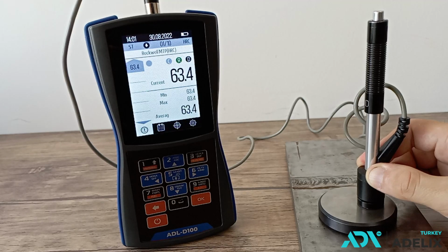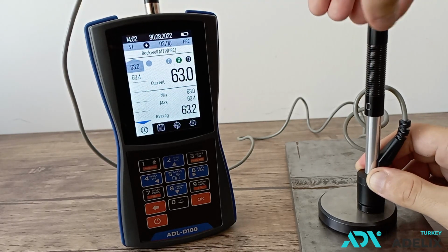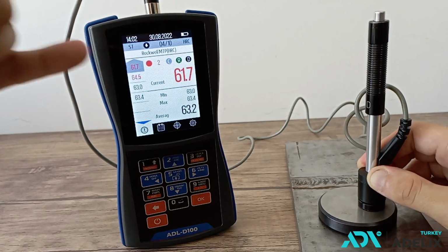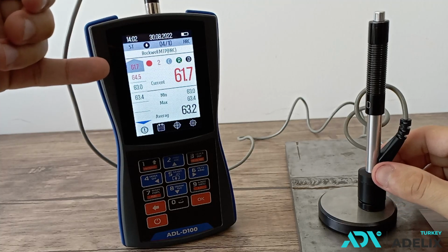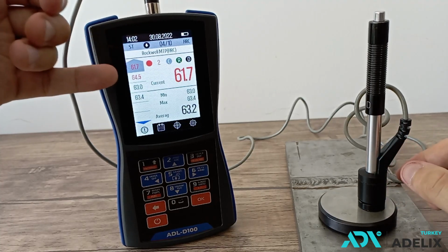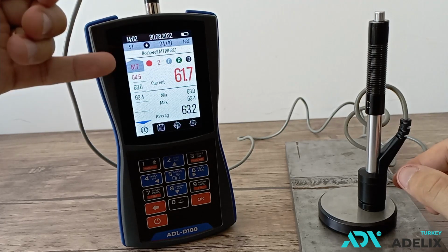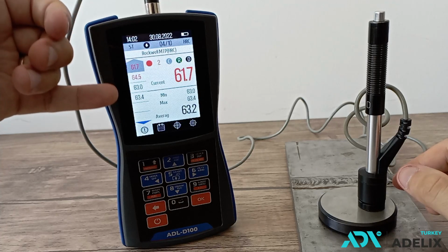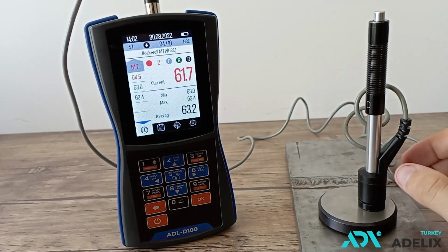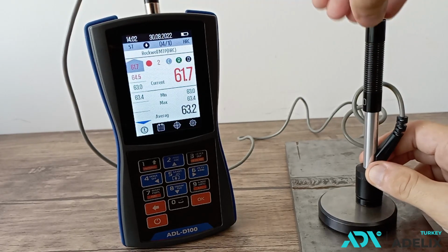When measuring, it is necessary to rearrange the sensor in order not to fall into the places of previous measurements. It is noticeable on the device screen that statistical processing has made calculations and eliminated too high and low deviations relative to other points. These points do not participate in the average calculation and are not visible in the minimum and maximum readings. Note that the statistical processing is called the standard deviation, SKO.